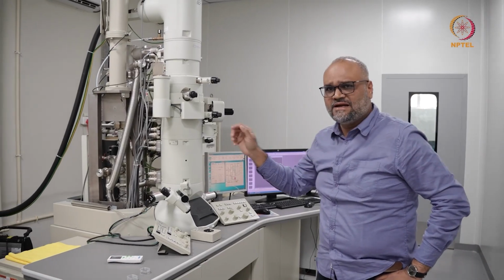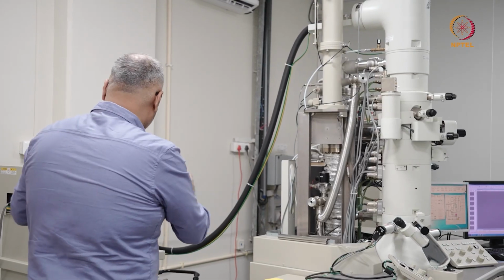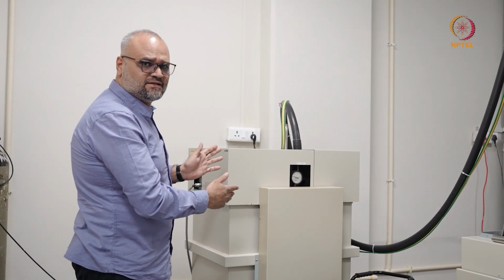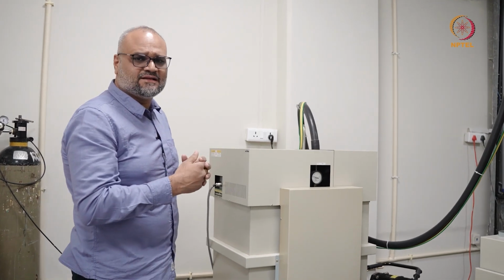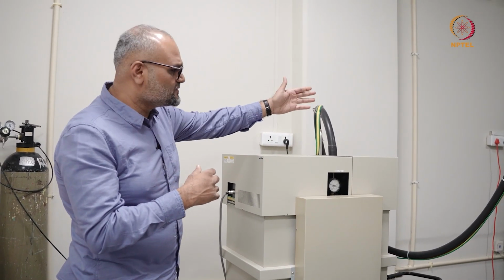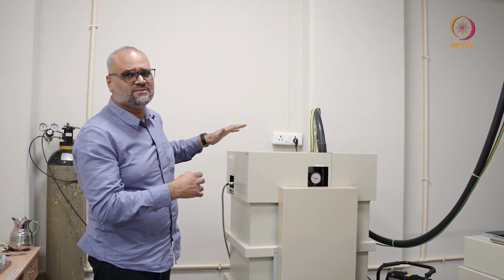Now, if I move behind the instrument, we'll look at the general layout of how a transmission electron microscope is laid out in laboratories in general. What you have is the main instrument column here. You have the high tension tank behind the microscope here. The high tension tank is essentially acting like a step-up transformer where you're withdrawing power from the main line, either at 100 or 230 volts, and then it runs through a loop over there, and you have the high tension tank acting as a step-up transformer.